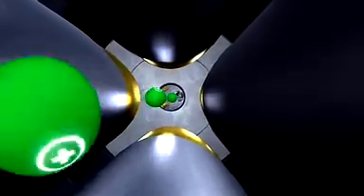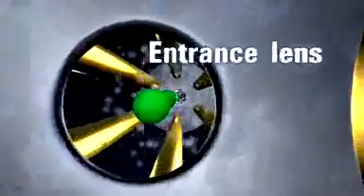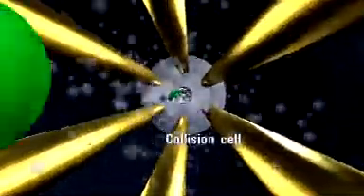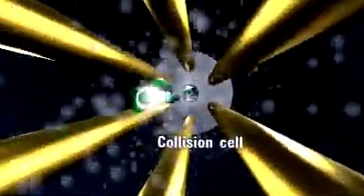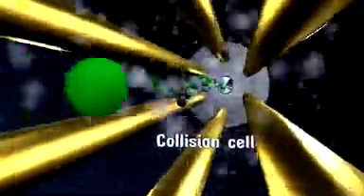The hyperbolic shape of the rods enhances ion transmission and spectral resolution. In the hexapole collision cell, precursor ions strike collision gas molecules, generating product ions and neutral fragments. Linear axial acceleration and high-collision gas pressure simplify operation and ensure fast, sensitive MS-MS without cross-experiment memory effects.